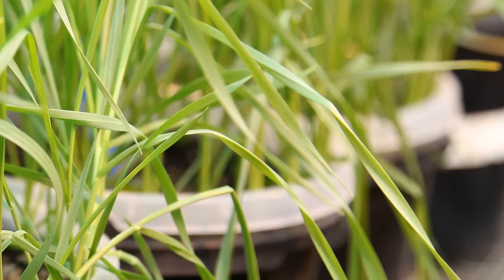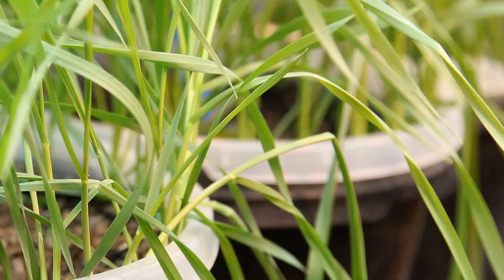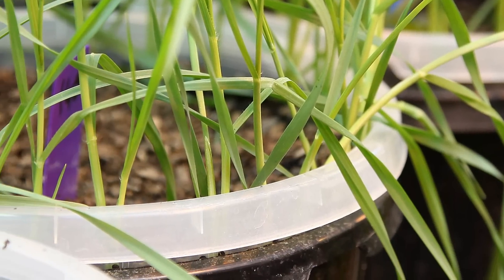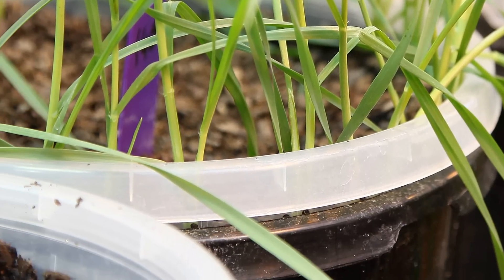The method is based on clear pots. The roots grow along the wall, and it is possible to measure different traits based on images captured at 5 to 10 days after sowing — for example, root angle or root number.